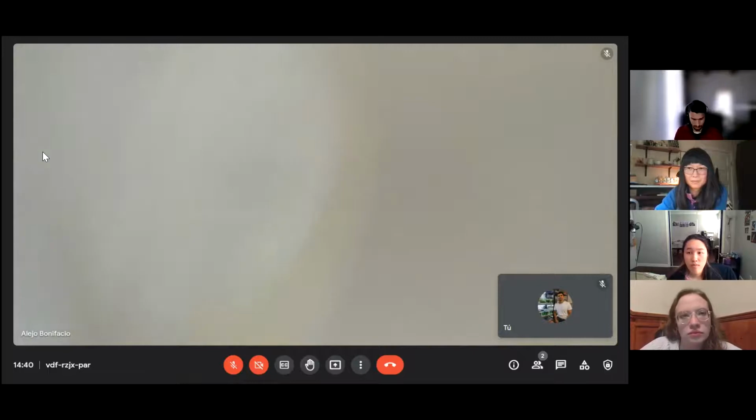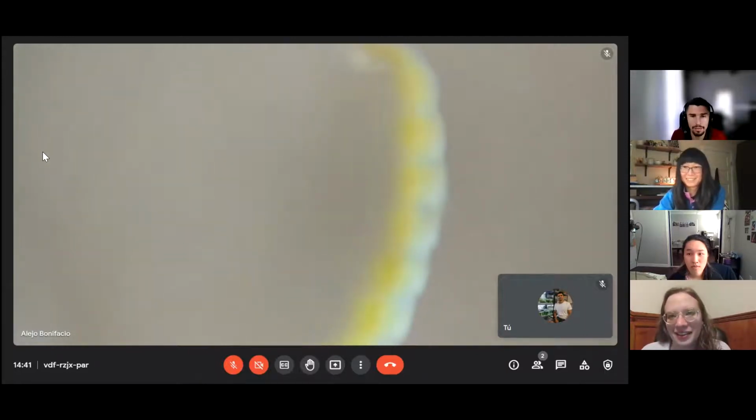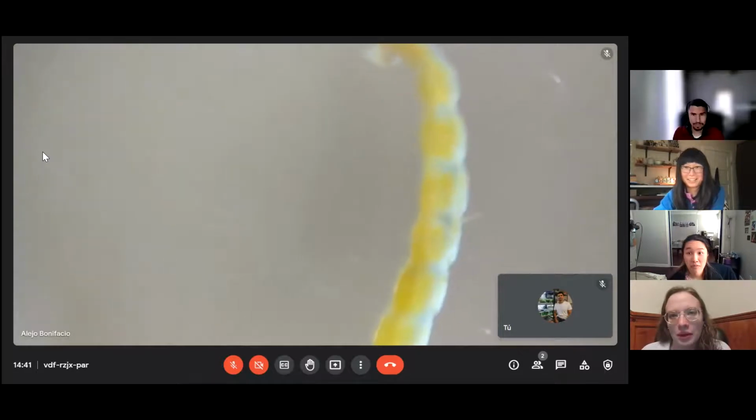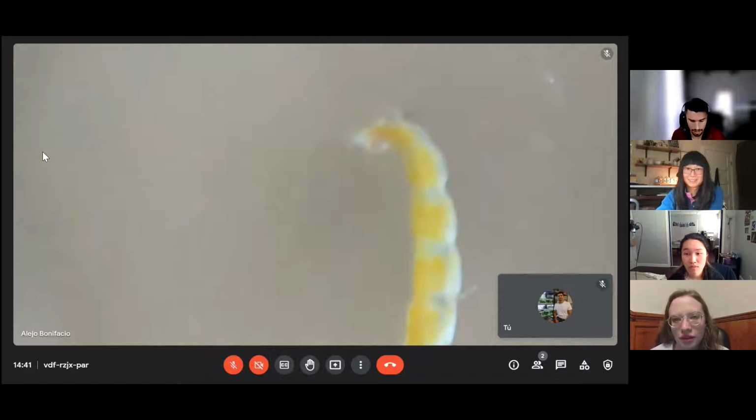Some of these bloodworms, or chironomids, is the family for these. The focus is for the other side. There are big animals, some of them more than a centimeter, when they are in the final stages of development. When you have some preserved material, you can see that this is the tail.